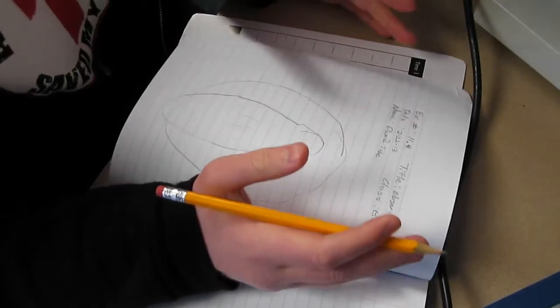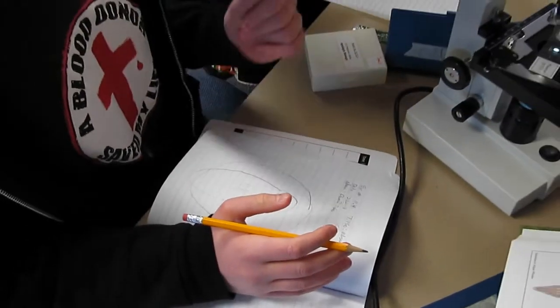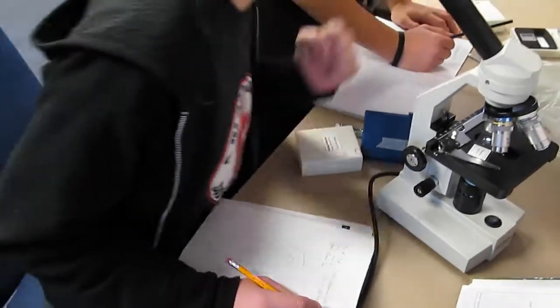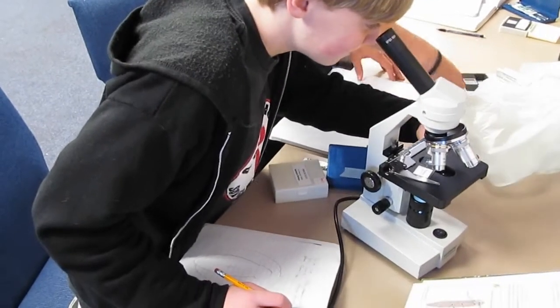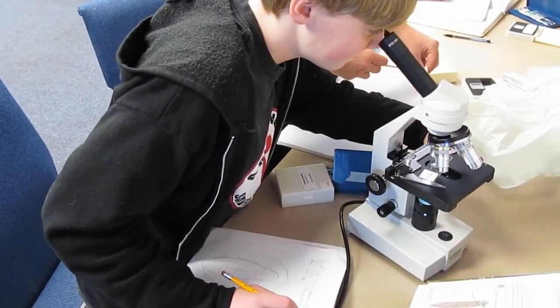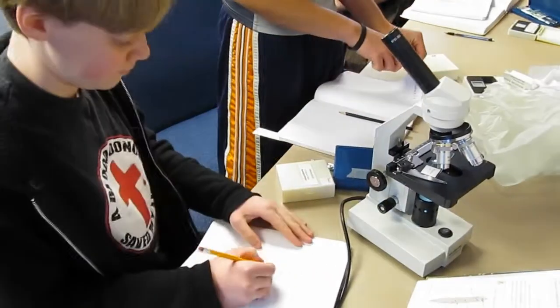Okay, how do we label anything? Does your Apologia book have a diagram in there to help you?